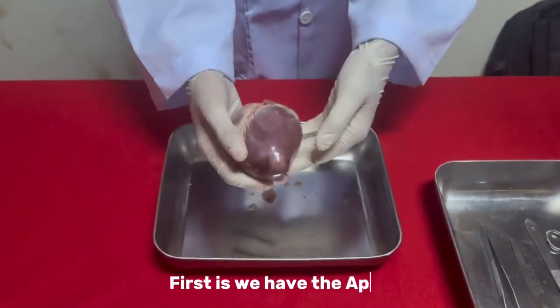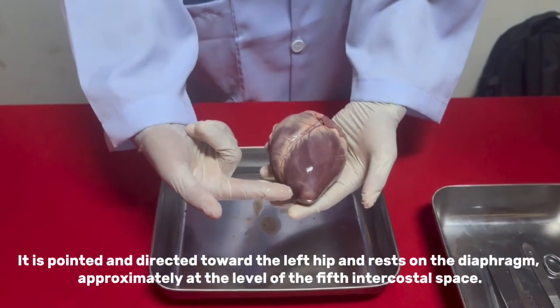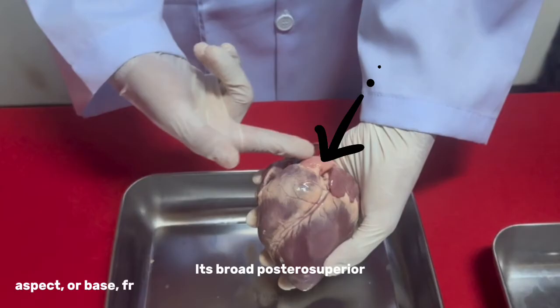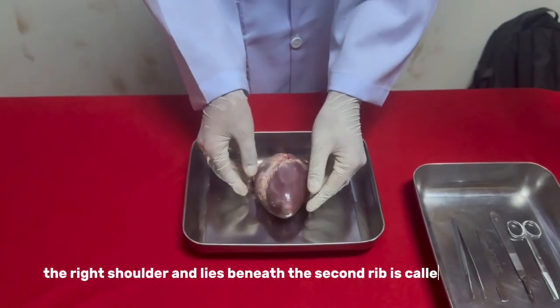First, we have the apex. It is pointed and directed toward the left hip and rests on the diaphragm, approximately at the level of the fifth intercostal space. Its broad posterior-superior aspect, from which the great vessels of the body emerge, points toward the right shoulder and lies beneath the second rib, called the base.